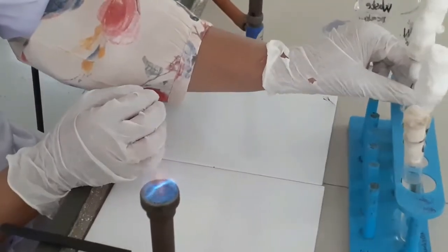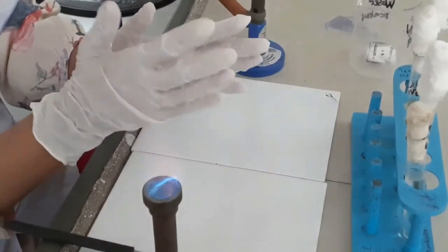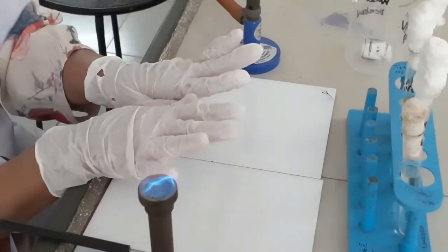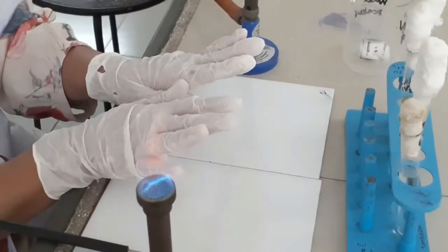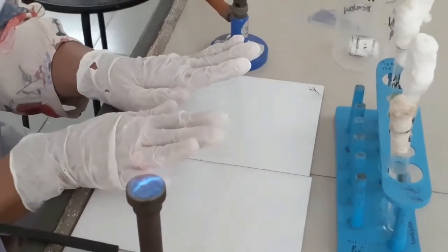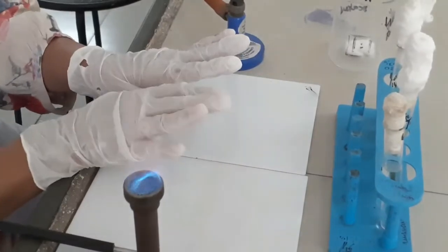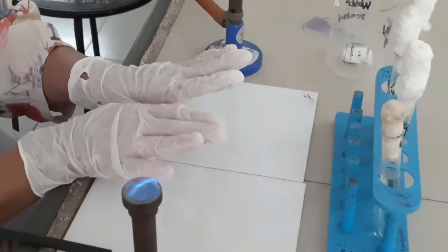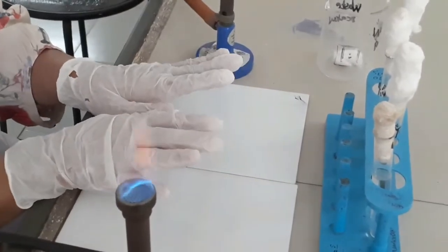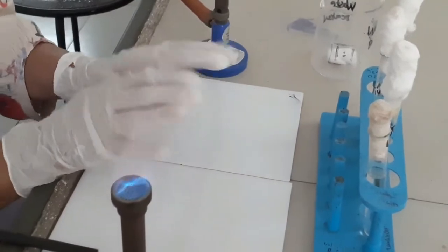We can simultaneously inoculate the positive control and negative control. After inoculation of all three test tubes containing slants of the Simmons citrate agar medium, these tubes are incubated at 35 to 37 degrees centigrade for 24 hours in an incubator, and after that the slants will be observed.